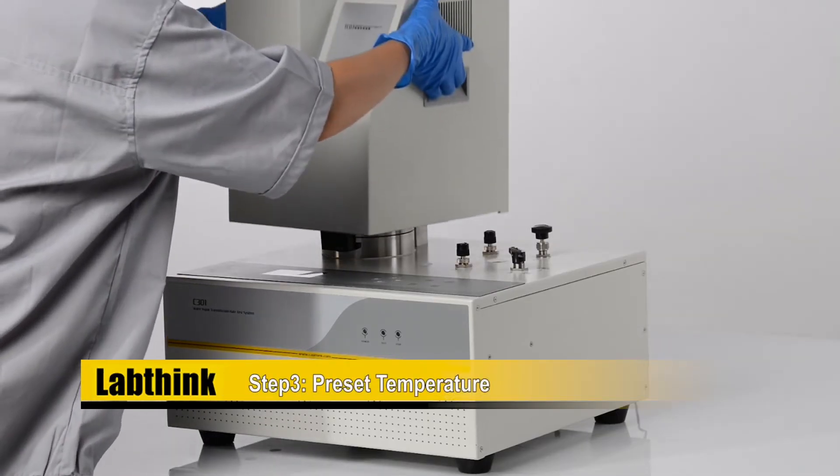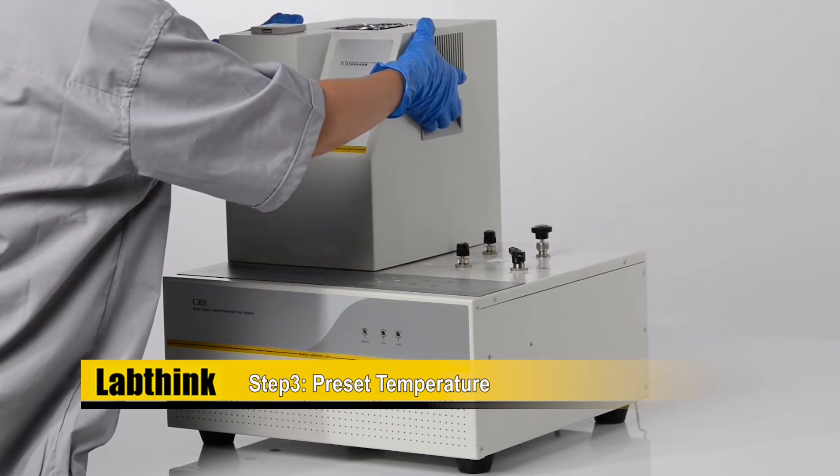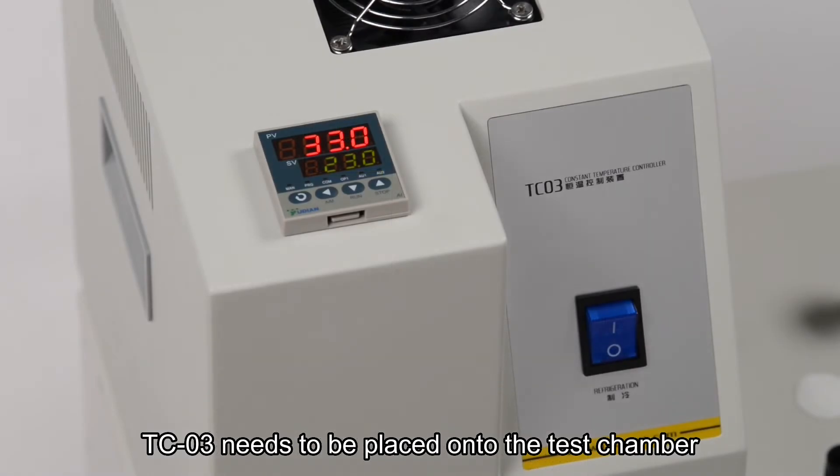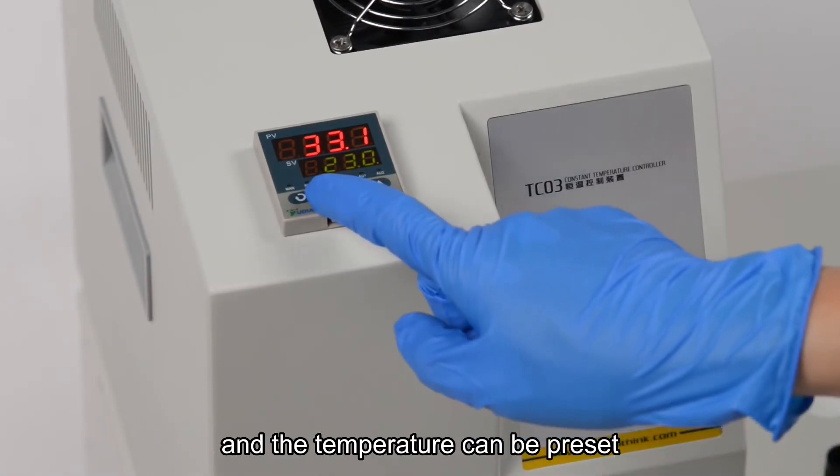Step three, preset temperature. TC03 needs to be placed onto the test chamber and the temperature can be preset.